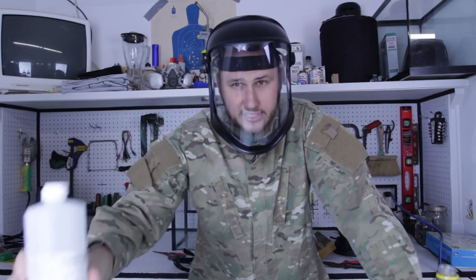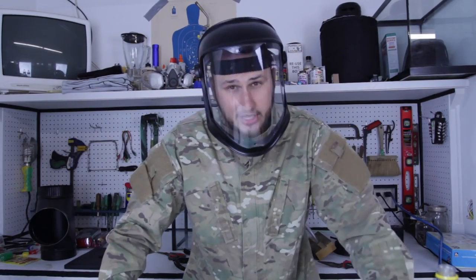I'm going to be using hydrochloric acid, 37%, and aluminum foils. Let's check this out.